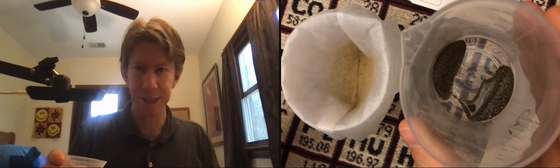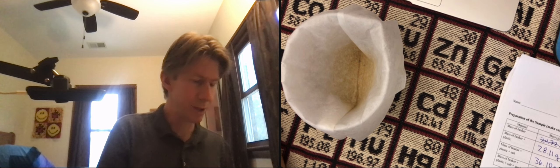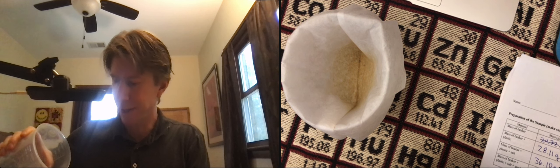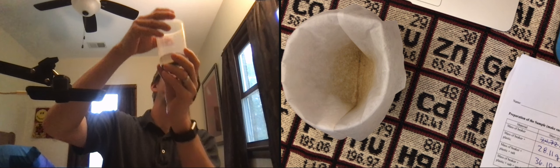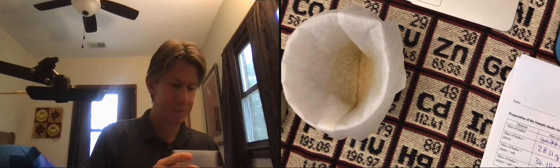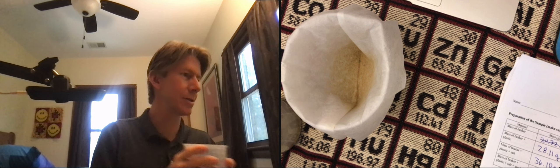And so here's my sand mixture. Here's my big beaker of water. And the exact volume doesn't matter here. Something like 50 milliliters. Let's see if I've got 50. A little less. That looks good.